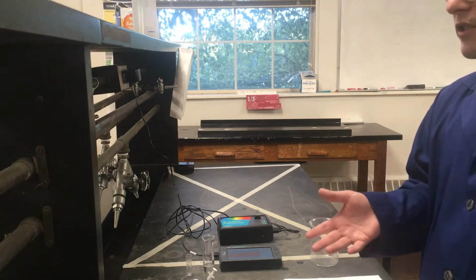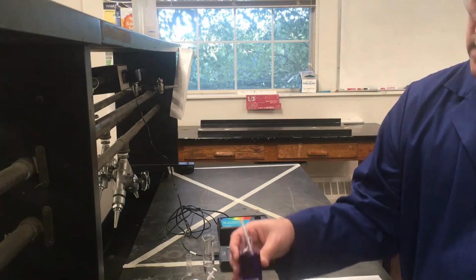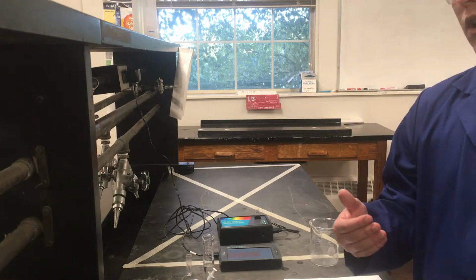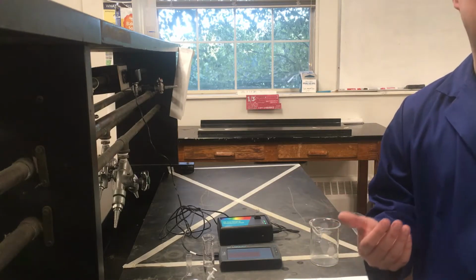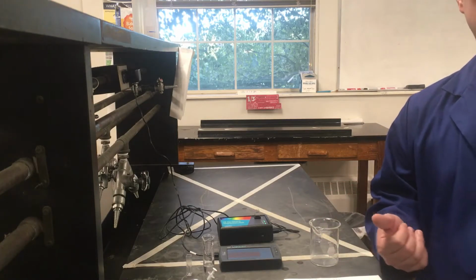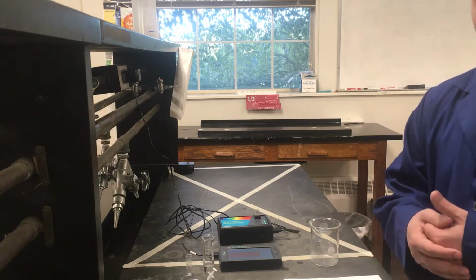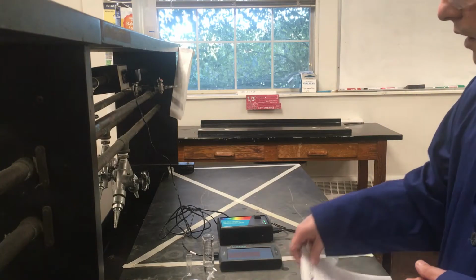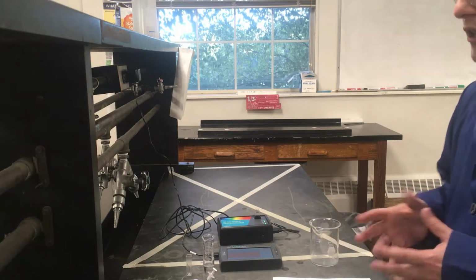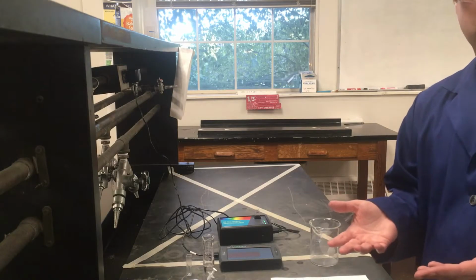Now, to do our first step, a simple dilution, the concentration we're given here is a stock solution of about 1.0 times 10 to the minus 4th molar, as I mentioned before. What we want it to be is 2.5 times 10 to the minus 5th molar, so basically a fourth of the current concentration. If you're trying to remember how to do a dilution, you can use the equation M1V1 equals M2V2. I have some of the calculations here that I'll go over at the very end of the lab to refresh people when I present all the data. But basically, it's a 1 to 4 dilution.